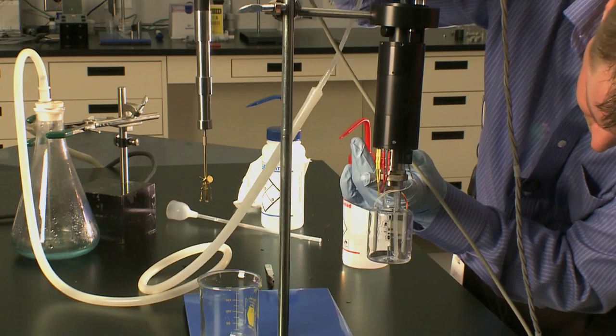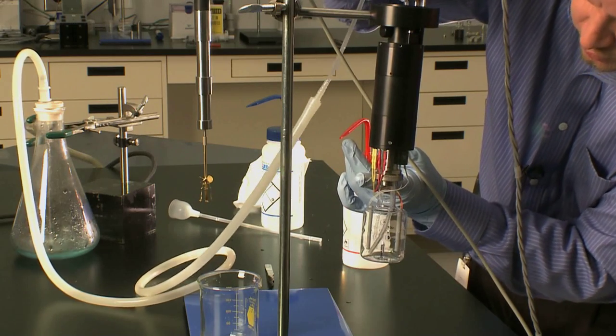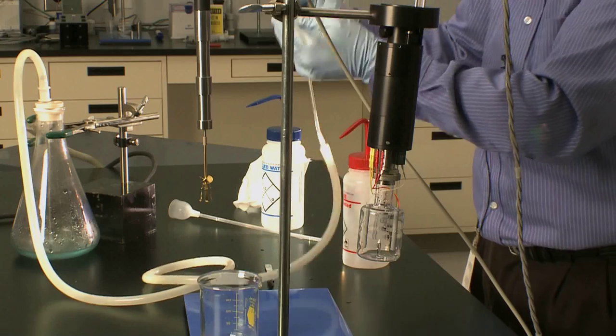I have one more little glass piece right here. I think I got it. Before the next experiment, you want to make sure that the vessel is dry.